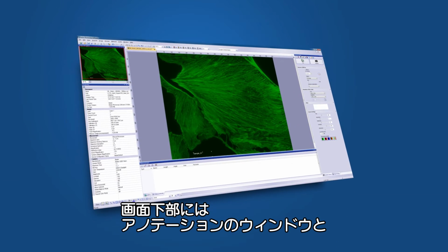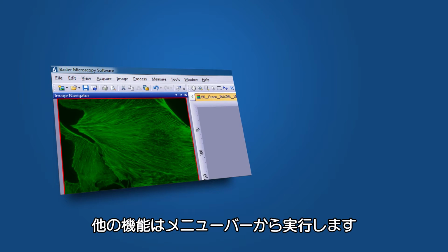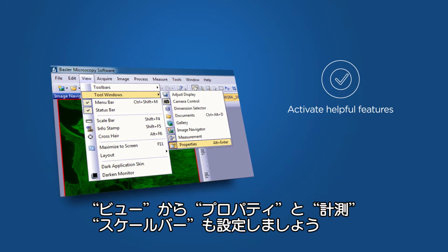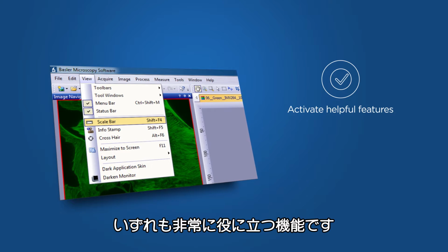At the bottom of your software window, you'll find the Annotation Window as well as information about the current zoom level and color values. More features are located in the top menu. Under View, I recommend activating the Property and Measurement windows, as well as the Scale bar. They all provide very helpful features.